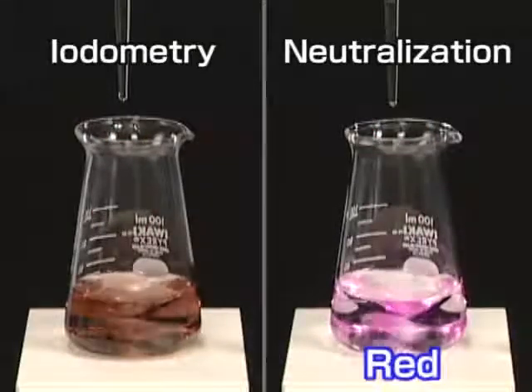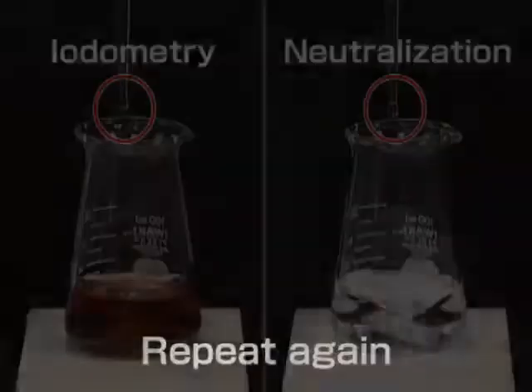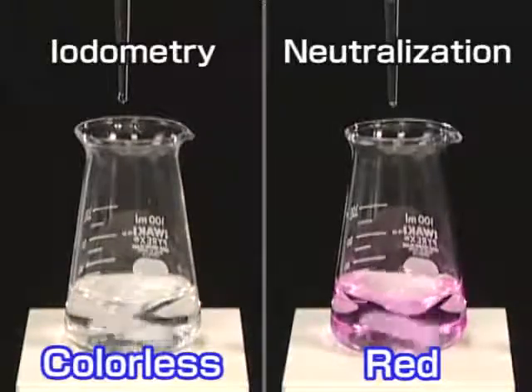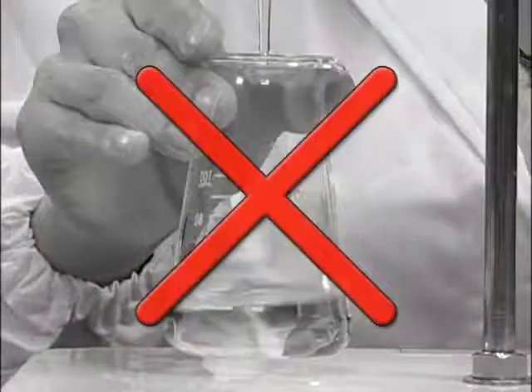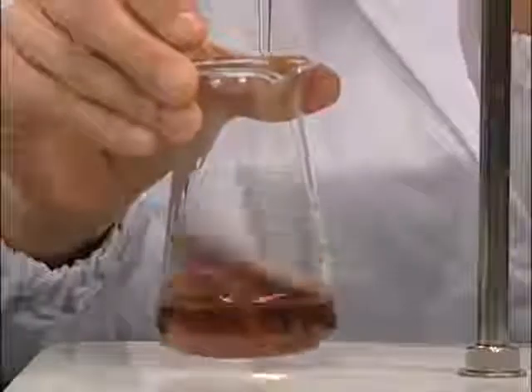Let's compare the color changes around the endpoints of iodometry and neutralization titration. It can be seen that the reaction of iodometry is a bit slow. Thus, you may end up adding excess of titrant of iodometry if you add it at the same rate as in neutralization titration. Pause for a while before you add the next drop.